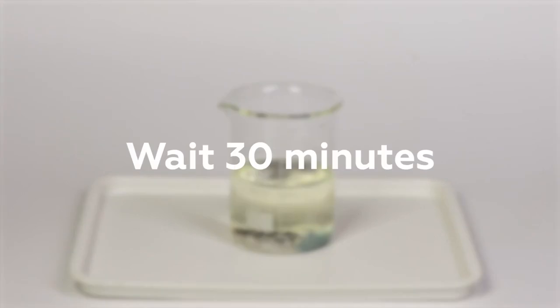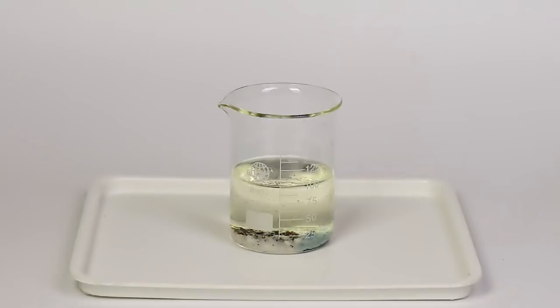Leave the reaction mixture for 20 to 30 minutes. During this time, chemical seaweed will grow in the beaker. The seaweed is very fragile, so do not shake, bump or disturb the beaker in any way during the experiment.